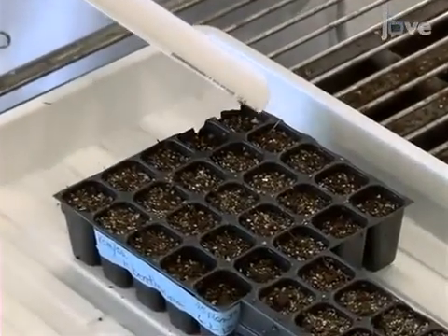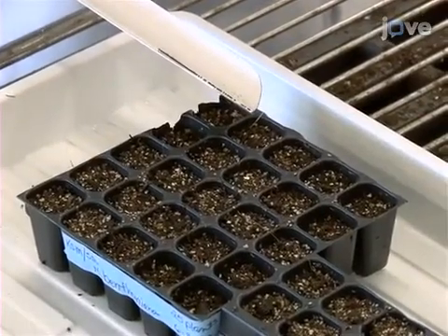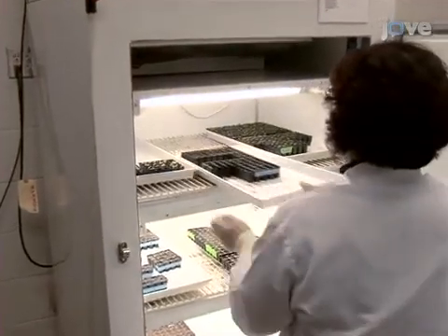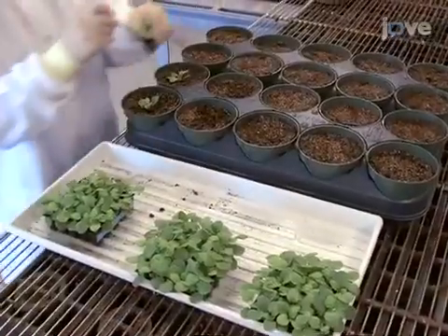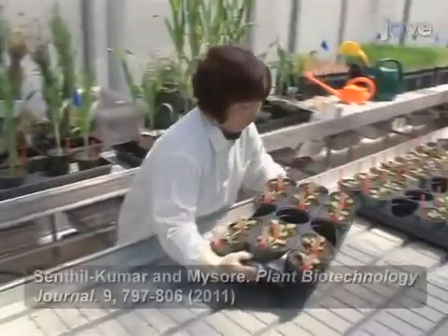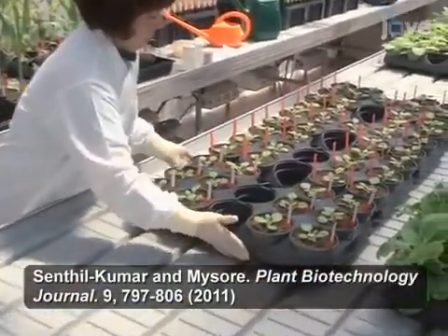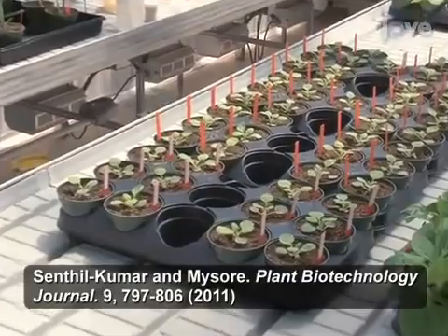Sow Nicotiana benthamiana seeds on a soilless potting mixture and germinate the seeds in a growth chamber. After three weeks, transplant the seedlings into individual pots. Grow them in a greenhouse for at least two to three days before the tobacco rattle virus VIGS vector inoculation.